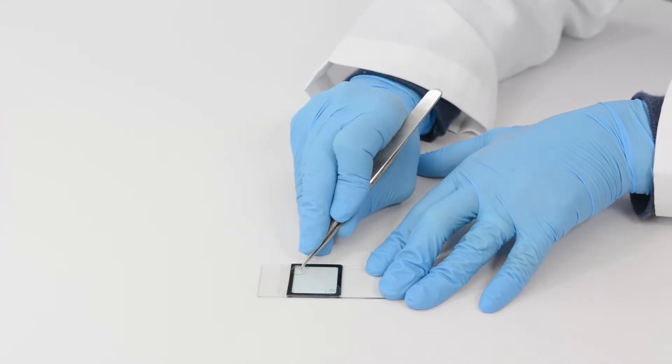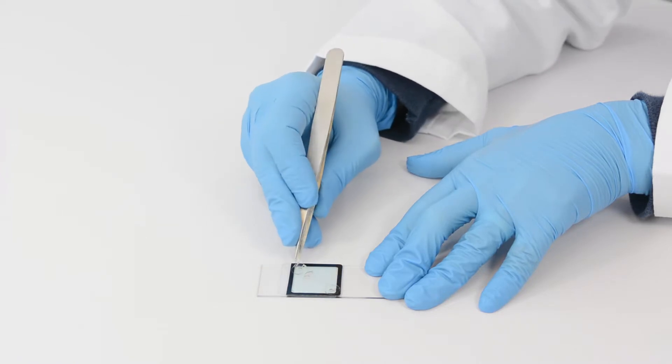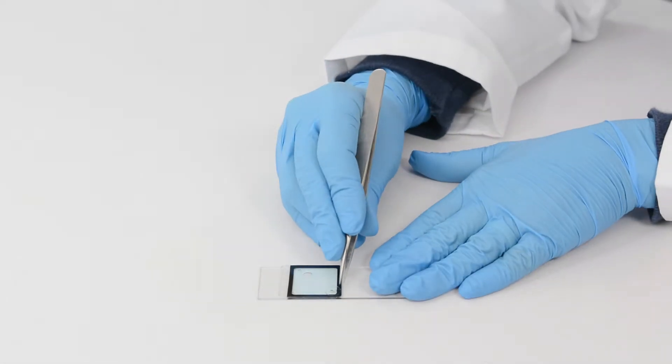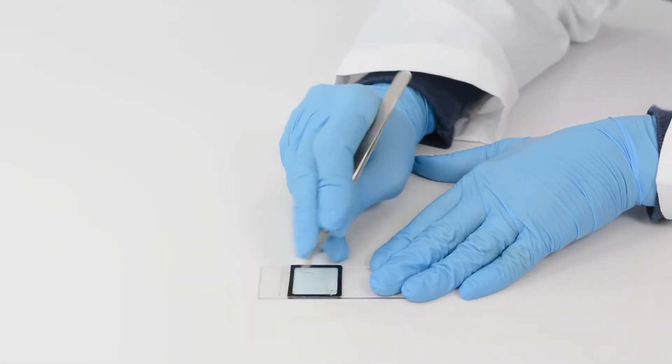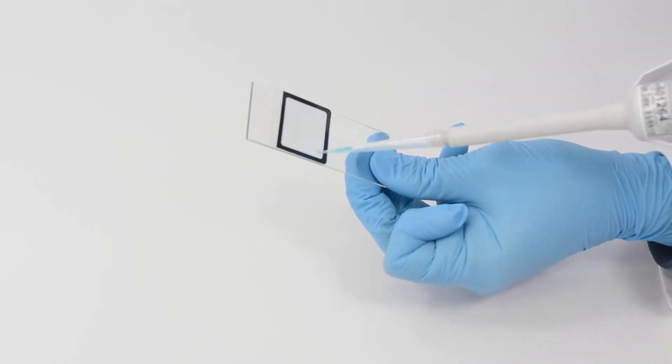Seal tabs can be removed to add or remove reagents. Reagent removal can be performed by pipetting the reagents out of the port.